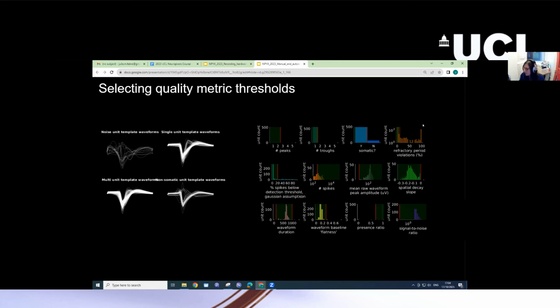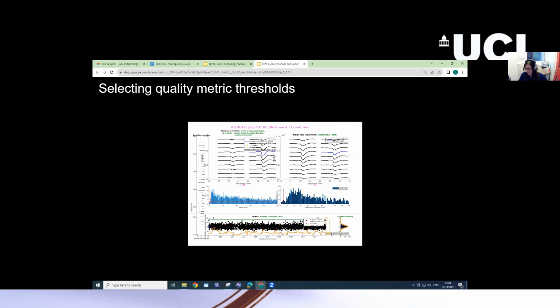These are the outputs if you were using BombCell as an automated quality metric tool, that display waveforms that have been classified in different ways and distributions of units for different metrics at different thresholds. And additionally, you want to look at your data, for instance, in a GUI, in order to get an understanding for what thresholds make sense for your data.